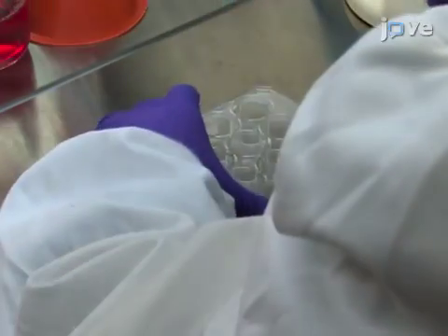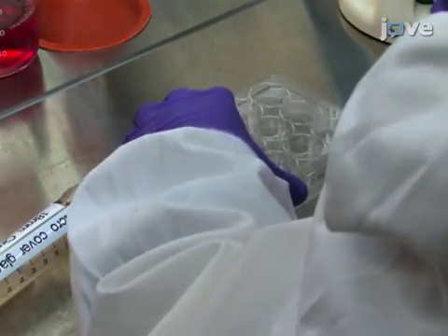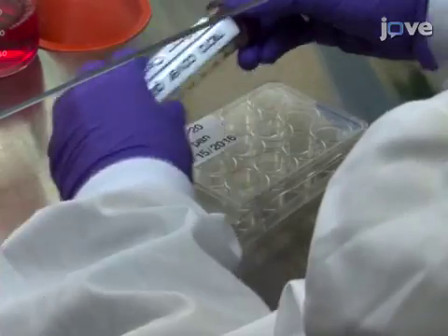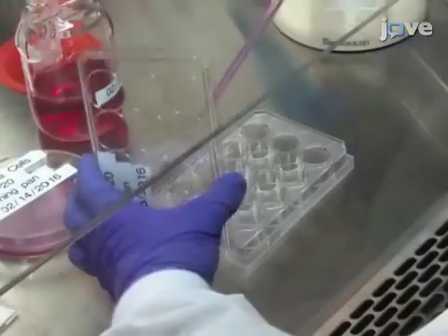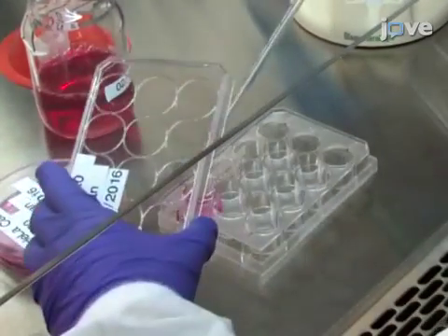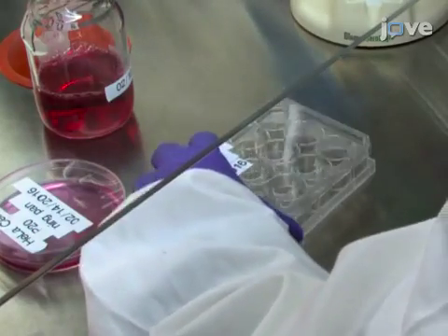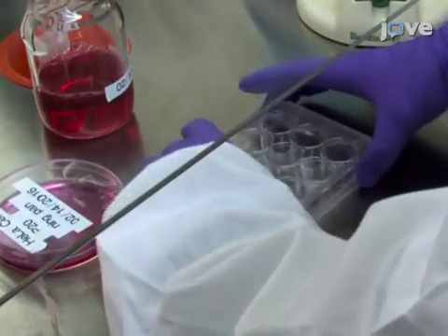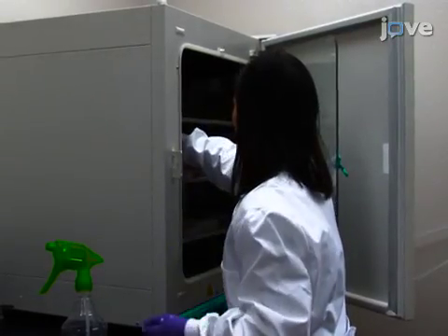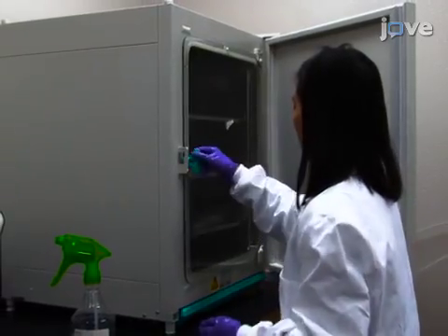To prepare the cell samples for single-cell mass spectrometry or SCMS experiments, first place individual micro-cover slides into the wells of a 12-well plate. Then add 1.8 milliliters of cell culture medium and 0.2 milliliters of cell suspension into the well. Gently mix the cells with mild agitation of the plate before incubating in a 5% CO2 environment at 37 degrees Celsius for approximately 24 hours.